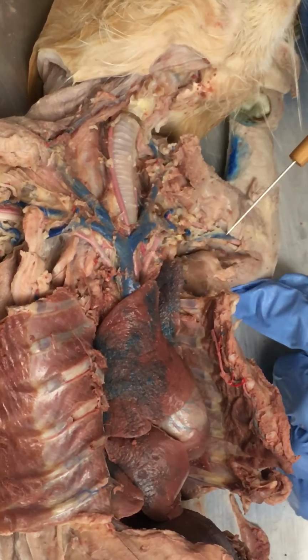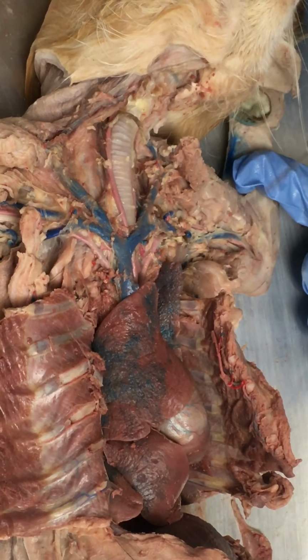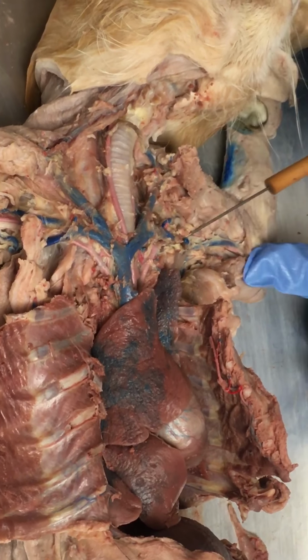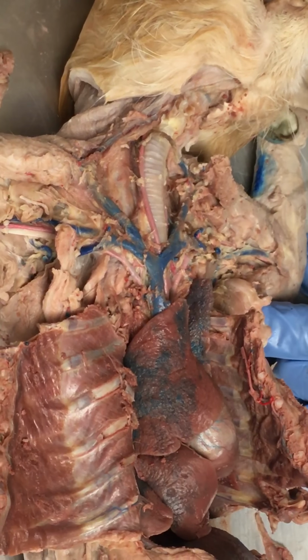And then down here, once we're clearly out and onto the arm, we'll call it the brachial vein. So subclavian, axillary, and brachial, just based on location. So that one vein has three names. One vein has three names. Great. Correct, that's awesome.